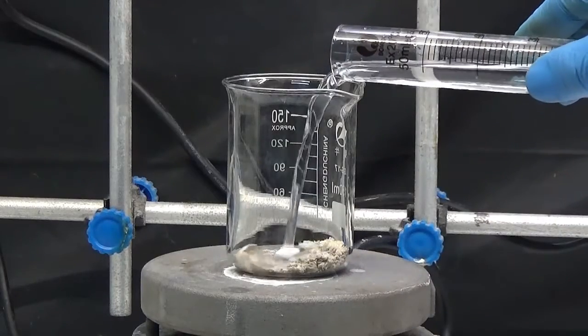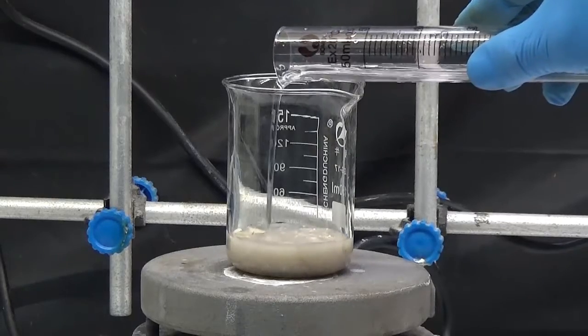Dissolve the solid in 100ml boiling water and filter while hot.